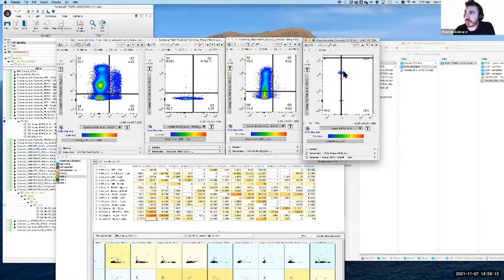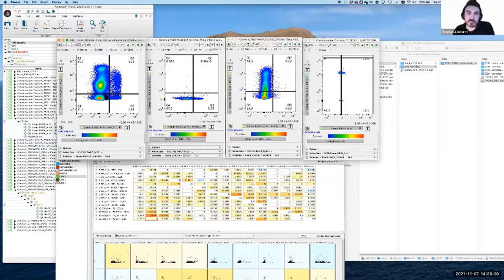So that's the goal. Fundamentally, the middle of this positive needs to line up with the middle of the negative. And if we do that correctly, what we'll see is that this is sufficiently aligned. This one basically shouldn't have any changes whatsoever because there is no PE-Cy7. And then the sample will look much better. It'll look like it's aligned correctly.